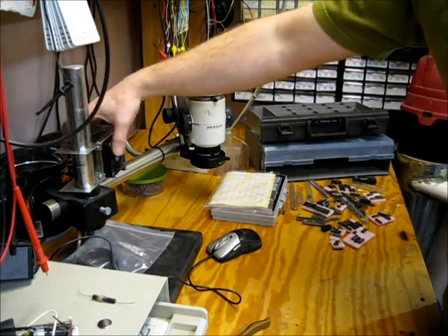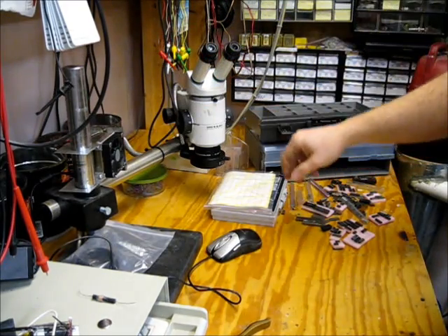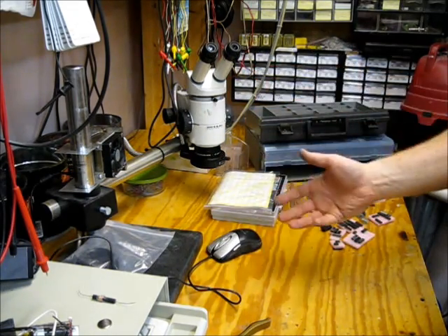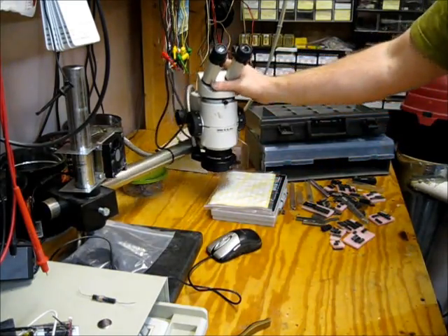It dawned on me that I could make a little bracket and just have it slide over this post that my scope sits on. Typically, I leave the scope at this height. I may move it up a few inches or down, but there is plenty of post for the range that I use my scope in.